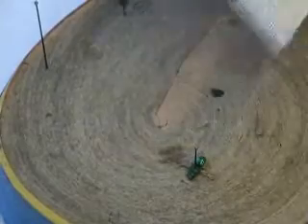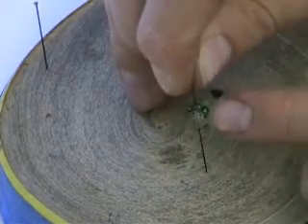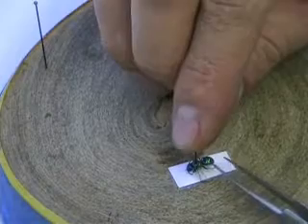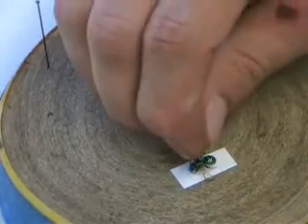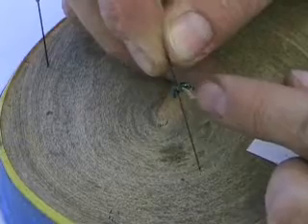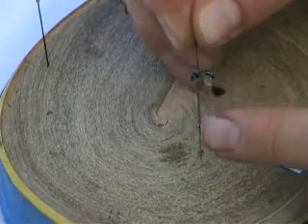It's not always accurate with larger specimens — things like beetles and other larger insects — and you'll have to adjust the pin to the right size. If the abdomen hangs down with smaller specimens, you can put a piece of paper underneath and slide the abdomen out. You can even manipulate the antennae and legs to position them so the specimen looks very nice. It'll dry in that position; once dry, remove the paper. Always leave at least 10 millimeters from the specimen to the top of the pin, and enough space for two to three labels at the bottom.